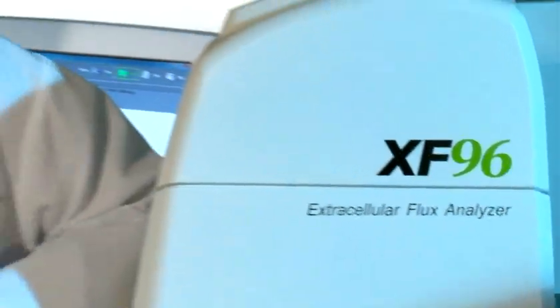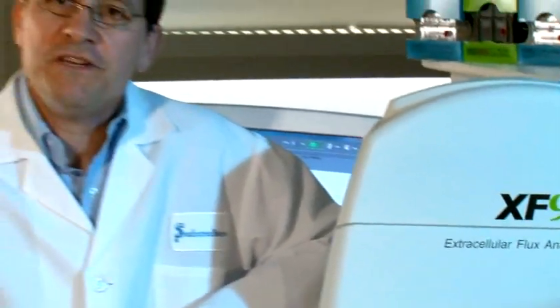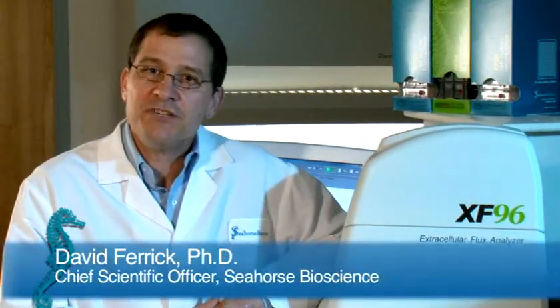Our customers tell us one of the most powerful features of the XF Analyzer is that it allows you to sequentially inject up to four drugs — be they inhibitors, stimulators, or substrates — into each well during the course of an experiment.